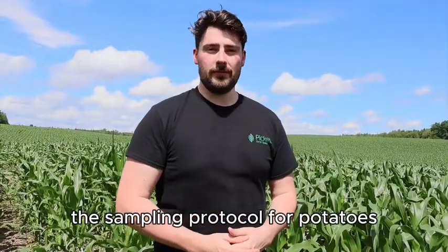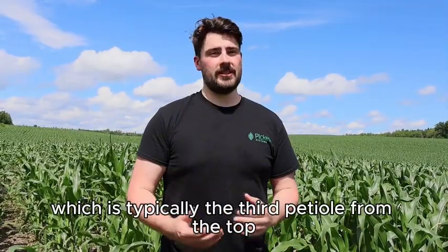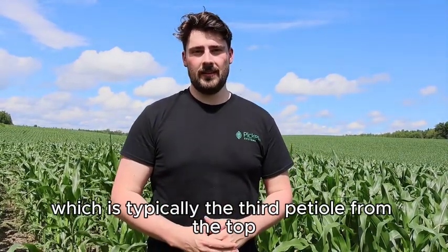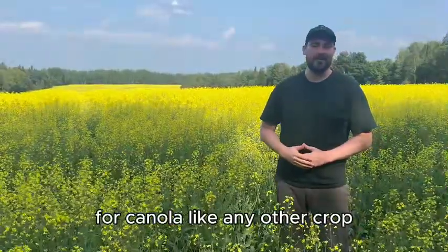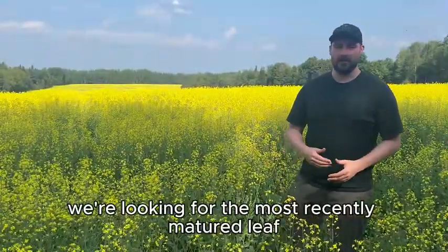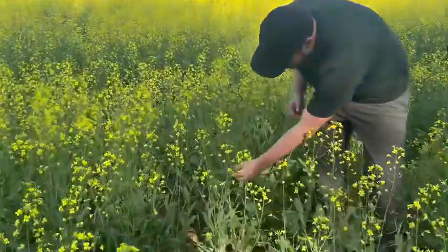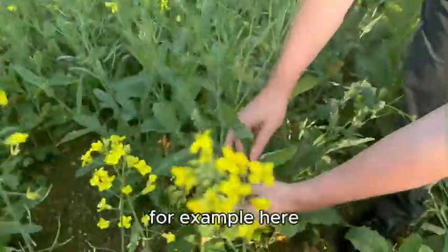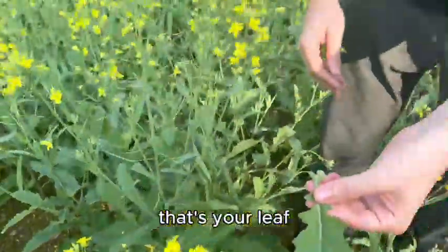The sampling protocol for potatoes would be looking at the most recently matured growth, which is typically the third petiole from the top, and selecting a leaflet from that. For canola, like any other crop, we're looking for the most recently matured leaf. This is typically the fourth or fifth leaf from the top. For example here, once you see a bit of separation from the stem, that's your leaf.